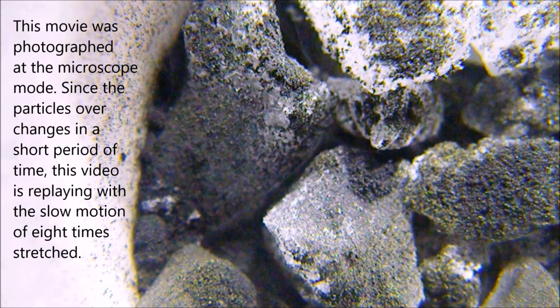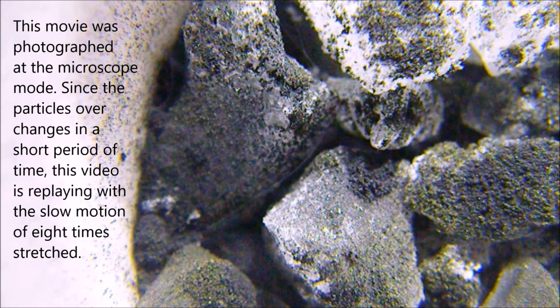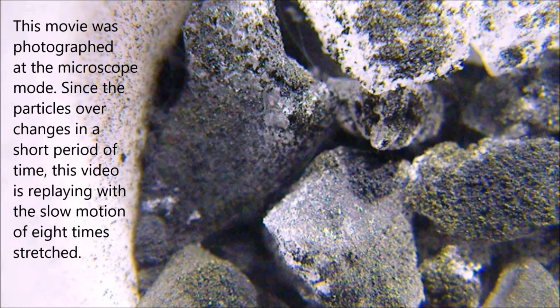This movie was photographed in microscope mode. Since the particles change in a short period of time, this video is replayed in slow motion stretched 8 times.